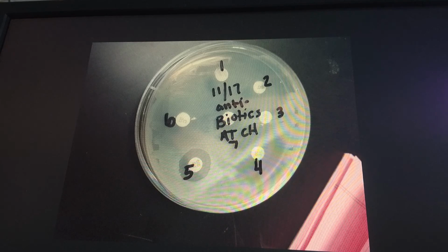Number 3 on the plate shows penicillin with a 0 millimeter zone of inhibition. E. coli is resistant to penicillin. E. coli is gram-negative and it has a thin peptidoglycan layer within the wall. Penicillin is a beta-lactam antibiotic which targets gram-positive bacterial cell walls in order to break down the bacteria, and it works by inhibiting cell wall enzymes needed to synthesize peptidoglycan. This means penicillin is unable to kill gram-negative E. coli.